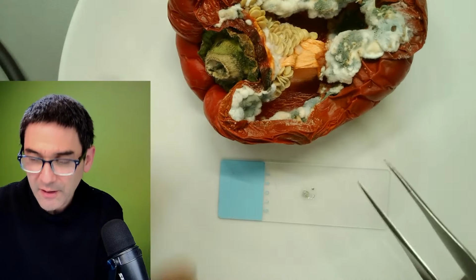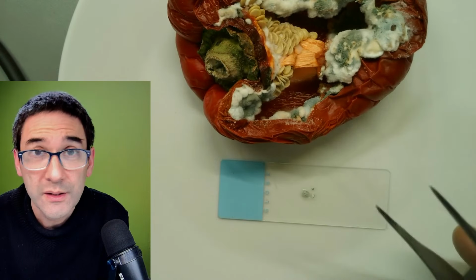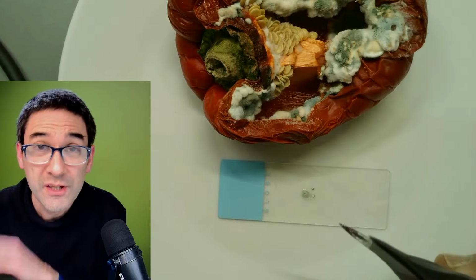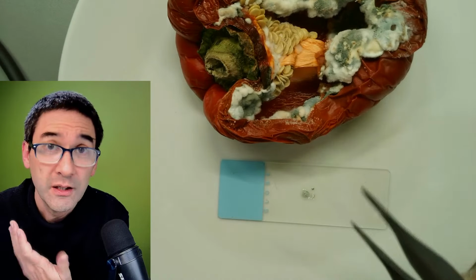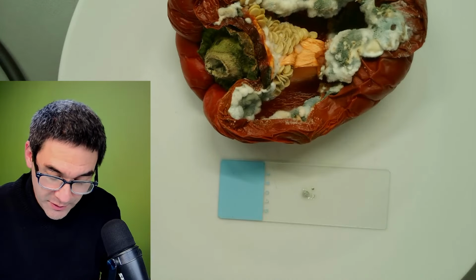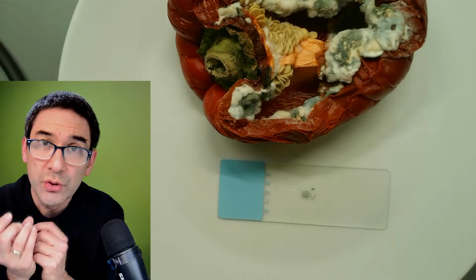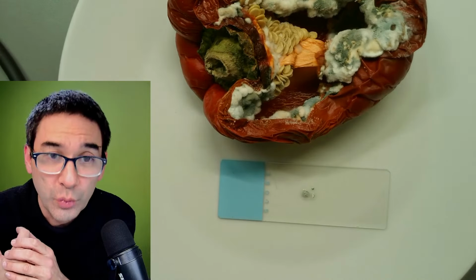If you want to have a safe source of fungi to look at, take some cheese, right? Some camembert cheese, brie cheese. They have cultures of fungus growing on them, which are defined, not poisonous. But you have to always be aware that whether a fungus produces a certain toxin or not depends very much also on the surface that it's growing on, right?